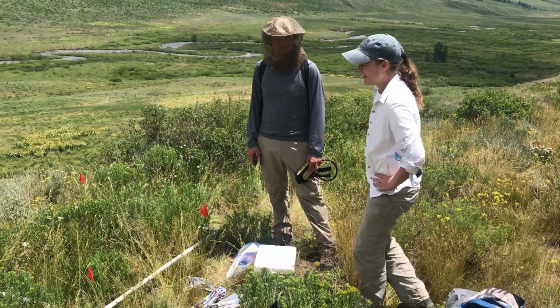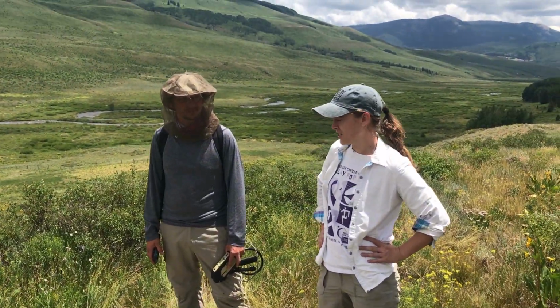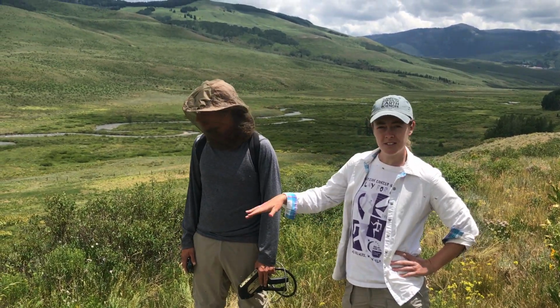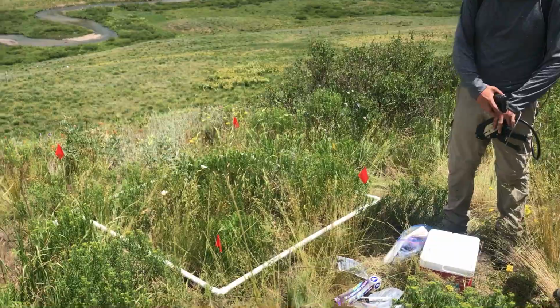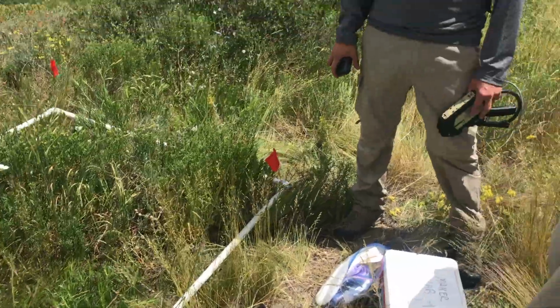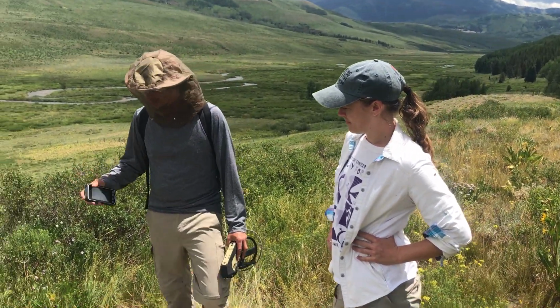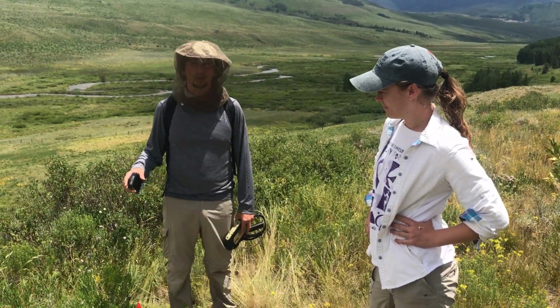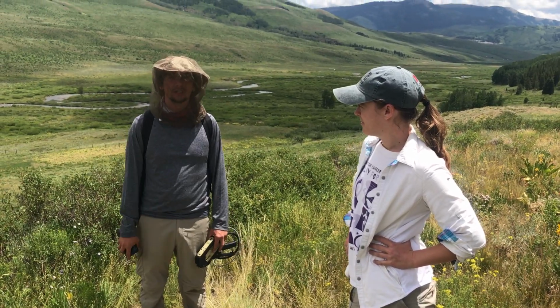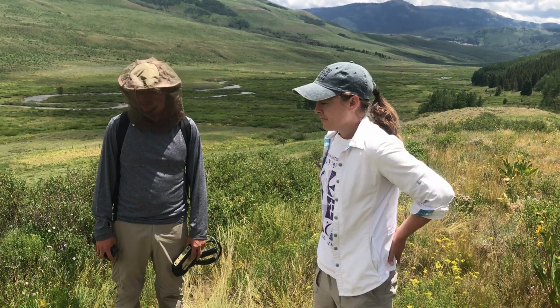All right, so we were able to do some hyperspectral imagery collection, and so now within the footprint of that collection we're setting out plots where we're doing measurements with a field spectrometer. We have been taking plot level measurements, and now we are also taking leaf measurements, and we are also sampling those leaves for chemical analysis and bringing them back to LBNL for more analysis.